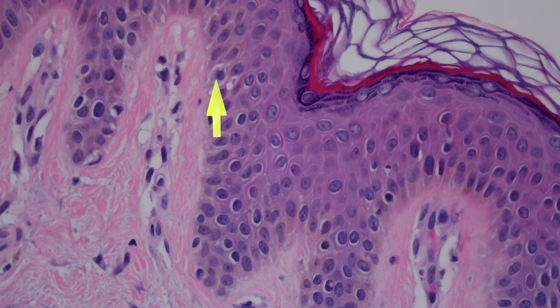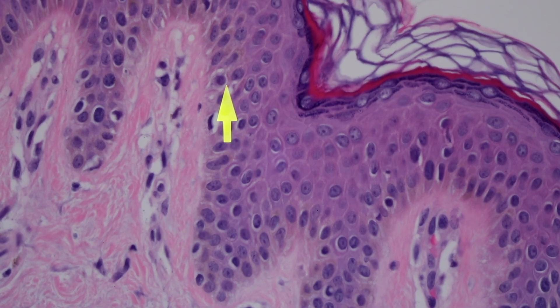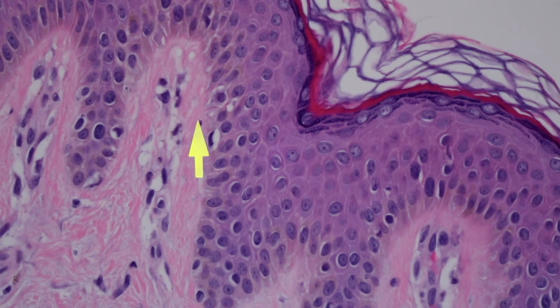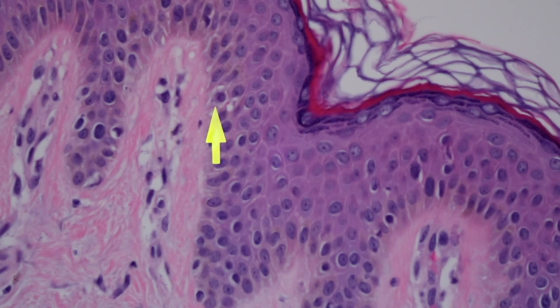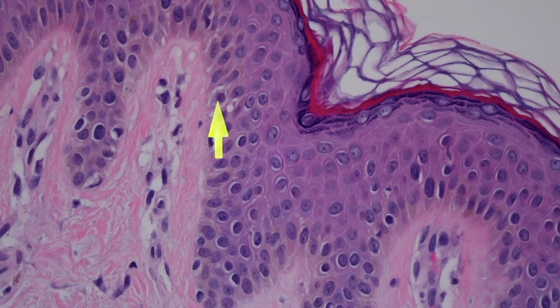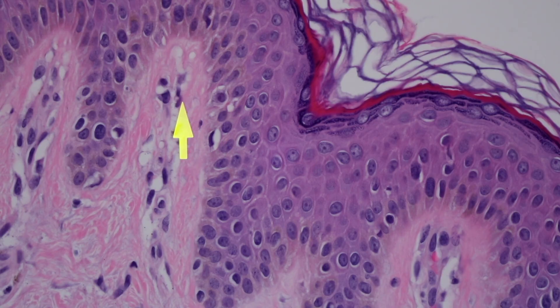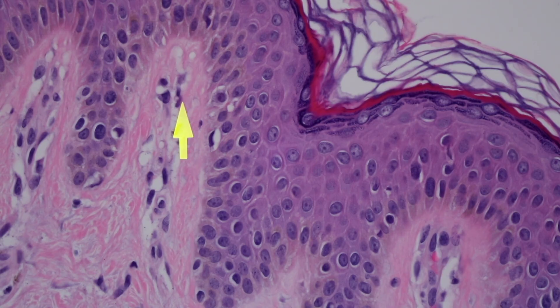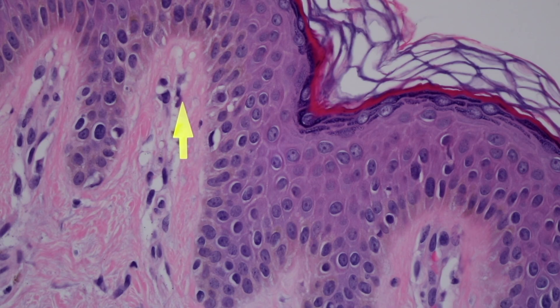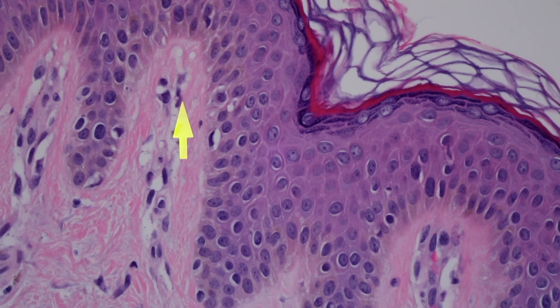This one guy right here is a little hard to get in focus, but he's a little bit gray and not quite as pink. He has a little vacuole around the outside - that little white space is an artifact of tissue processing. When we soak the tissue it doesn't come out of your body pink and purple like this; we have to soak it in formaldehyde or formalin and run it through a series of different chemicals to make sure the tissue doesn't break down.